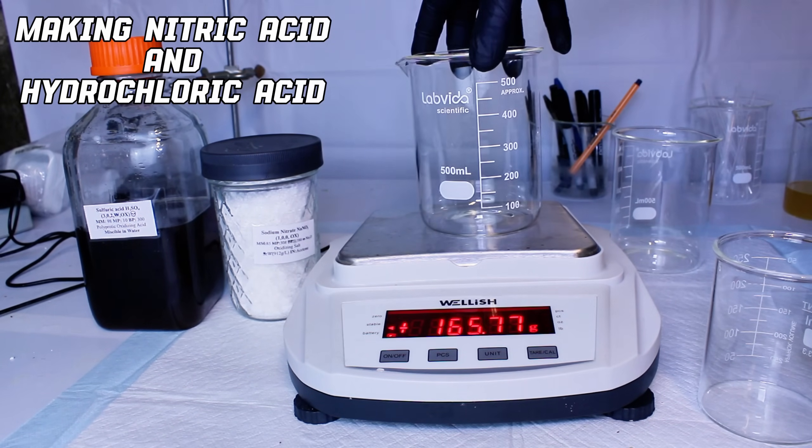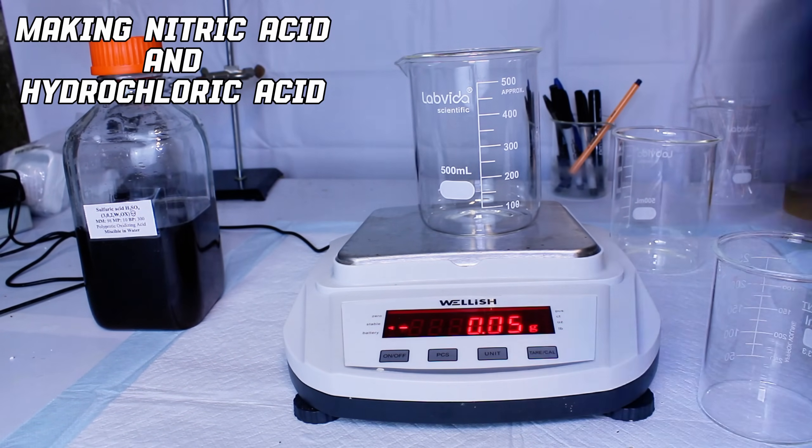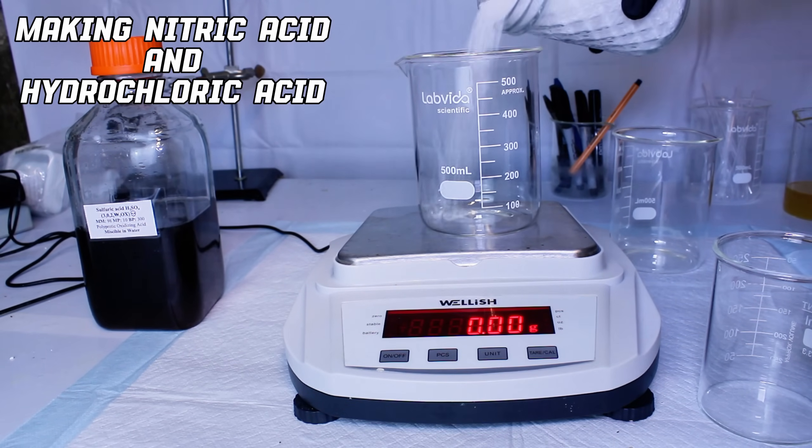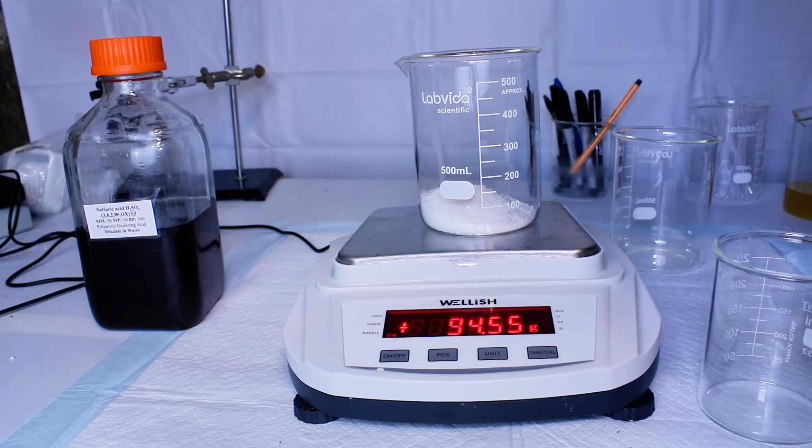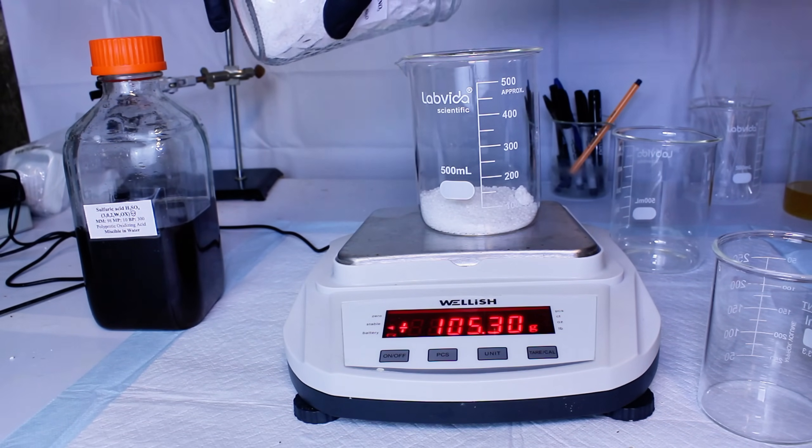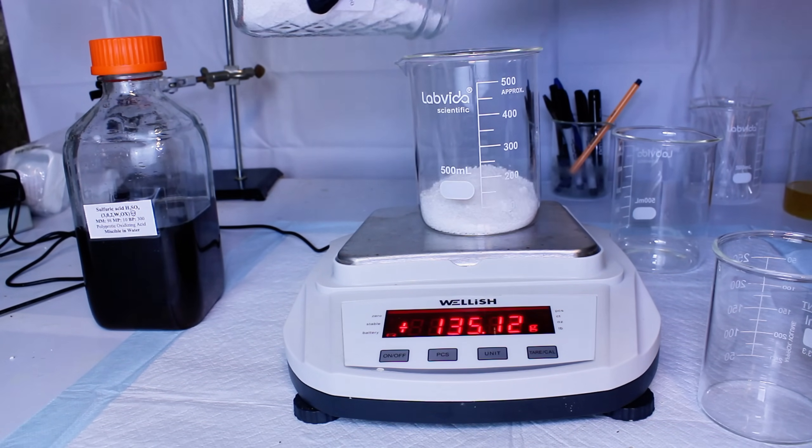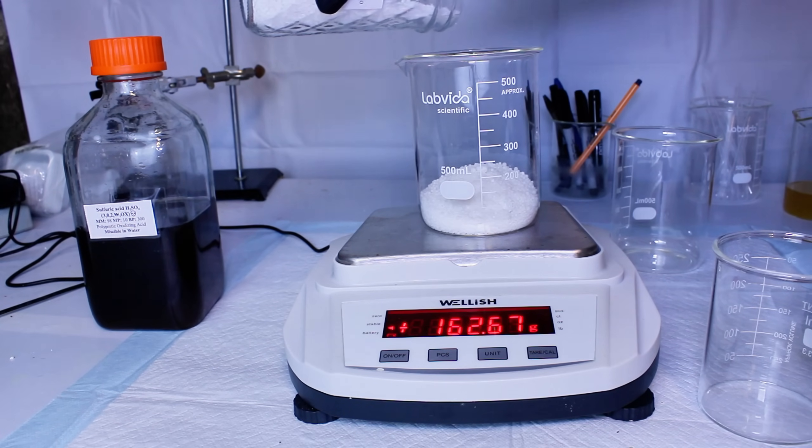Today I'm going to show you how to make nitric acid and hydrochloric acid and also talk a bit about making acids in general. Making nitric acid is probably the process I do most often behind the scenes as nitric acid and hydroiodic acid are the only acids I can't easily buy where I live. And unlike hydroiodic acid, nitric acid is extremely useful.